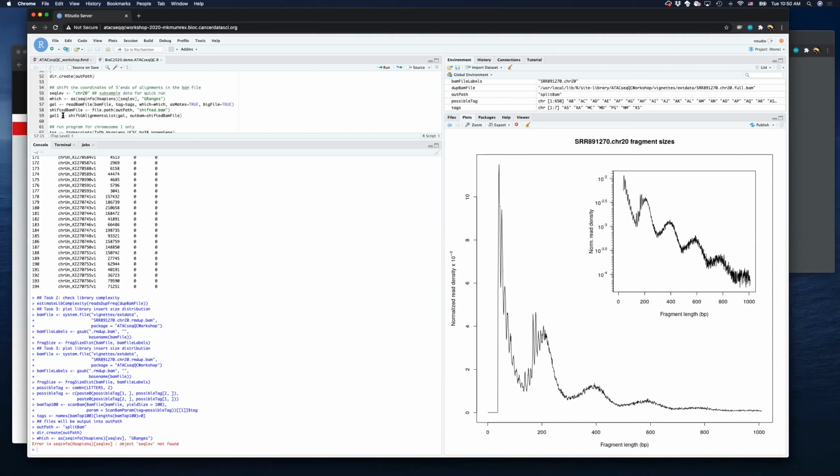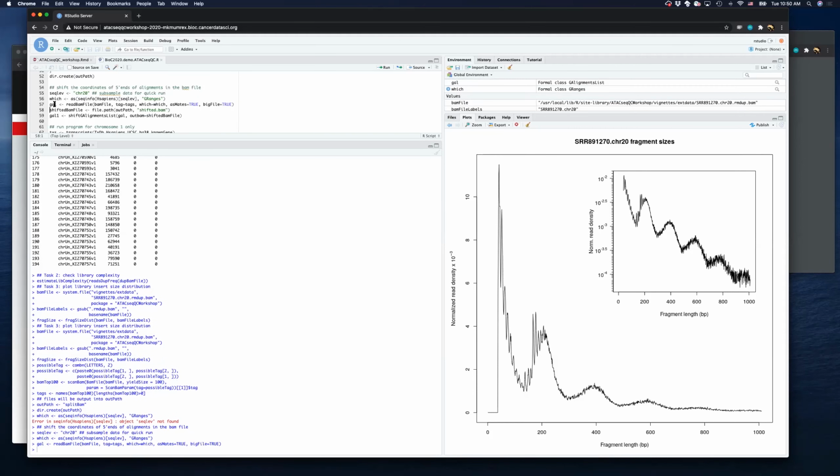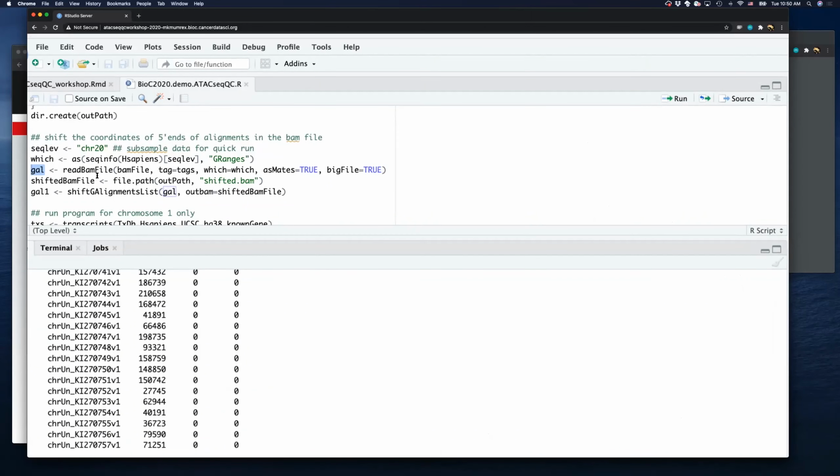For the seq level, I did not run this step. Okay, this reads the BAM file. If we set the big file option as true, then it will not read the BAM file into memory. You can see it will give you 0 elements. It will read the file later, because loading the whole BAM file into memory would cost a lot of memory. So I designed it to read later.